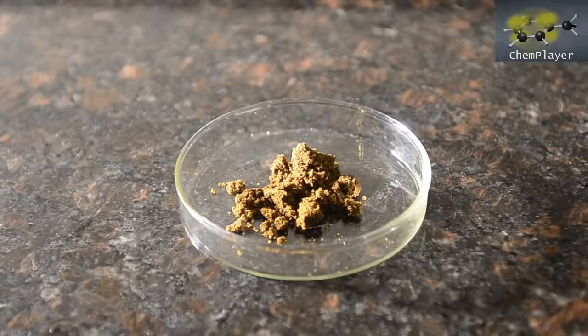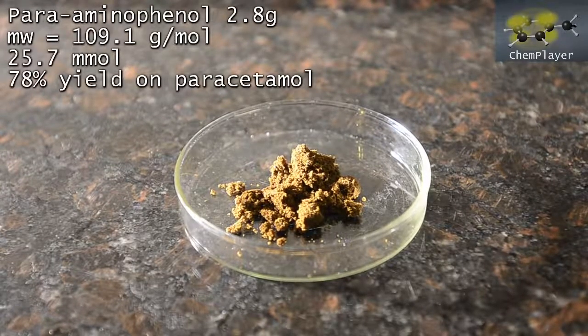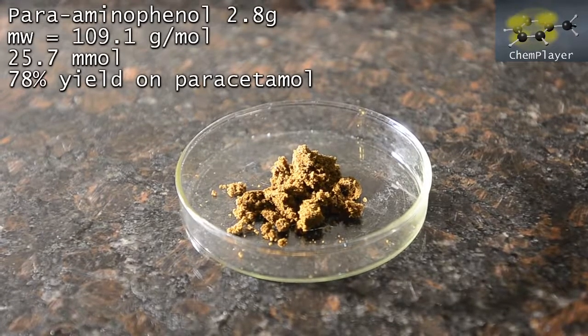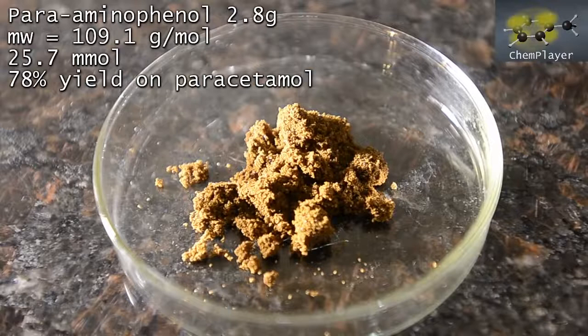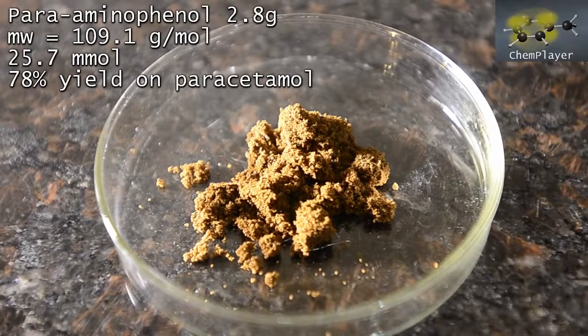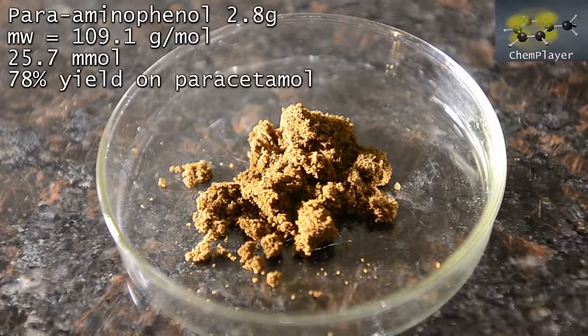And our recrystallized product, 2.8 grams of para-aminophenol as dry tiny crystals. But it's still brown. This substance is a bit like anthranilic acid. Trying to purify by recrystallization is quite difficult and results in dark decomposition products forming. Well, if it's pure, this represents a 78% yield on our starting paracetamol.